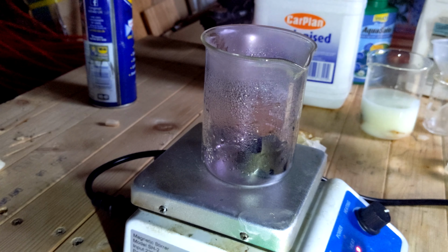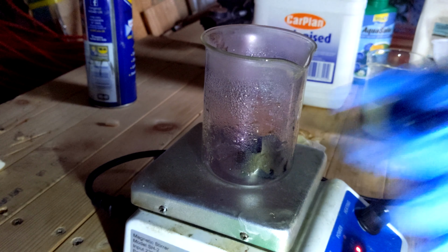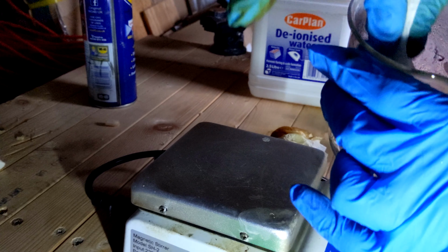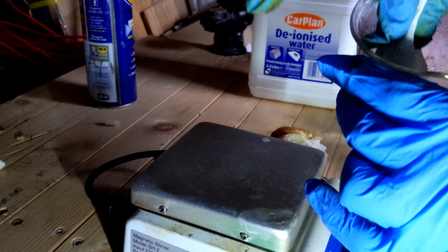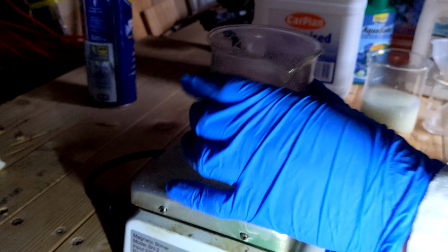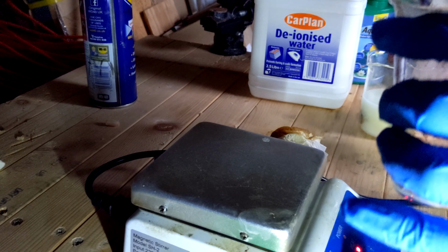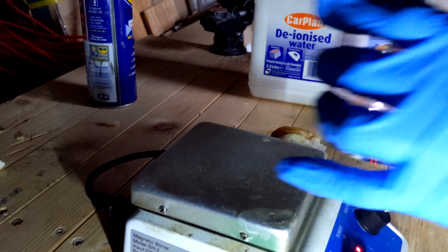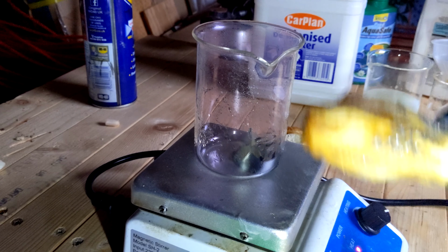You can hear me holding my breath because I didn't want to breathe in the iodine, which wasn't actually that bad, to be honest. Iodine is not as strong as chlorine. I was afraid that the whole garage I'm doing this in would fill up with iodine vapors, like a room full of bleach and acid.